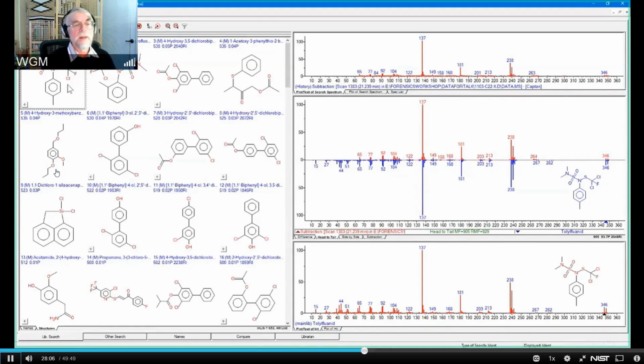So I think of this as closing the loop. That is to say, I have basically taken one spectrum out of that mix, and I said, okay, I'm taking that out, and then what's left, and then I take out what showed up once I took that out. And in both cases I've gotten substantial improvement. From having no identification of captan, I've gotten a good identification, in the high 800s. And I've gone from having a pretty good identification for the other pesticide to having a very good identification for that other pesticide.